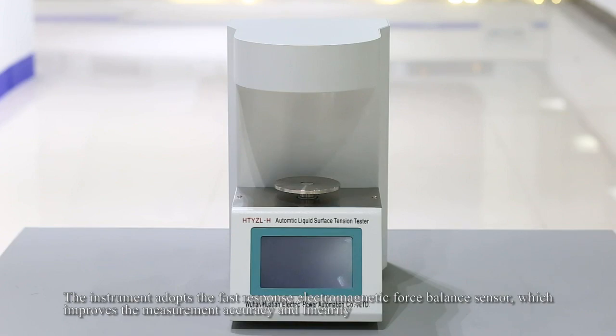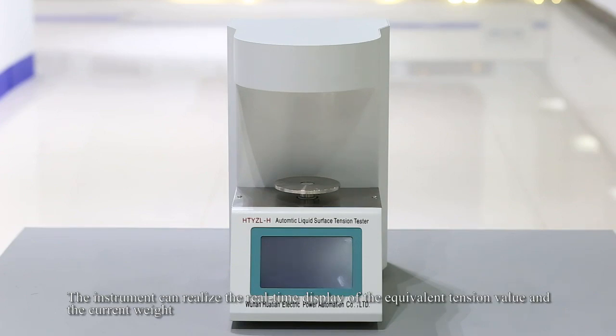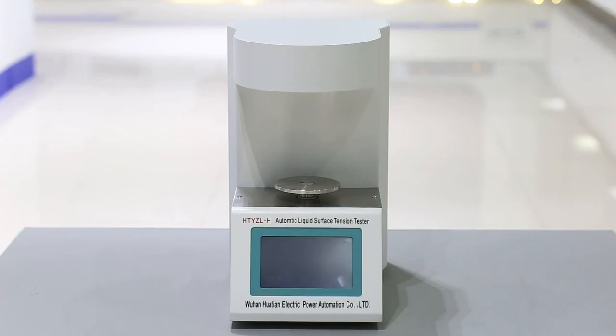The instrument adopts a fast response electromagnetic force balance sensor, which improves the measurement accuracy. The calibration of the instrument only needs one point, eliminating the need for the zero potentiometer and the full range potentiometer. The instrument can realize the real-time display of the equivalent tension value and the current weight.